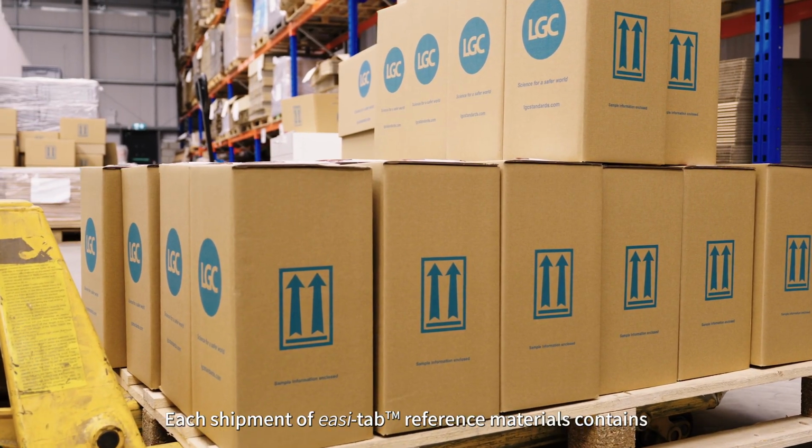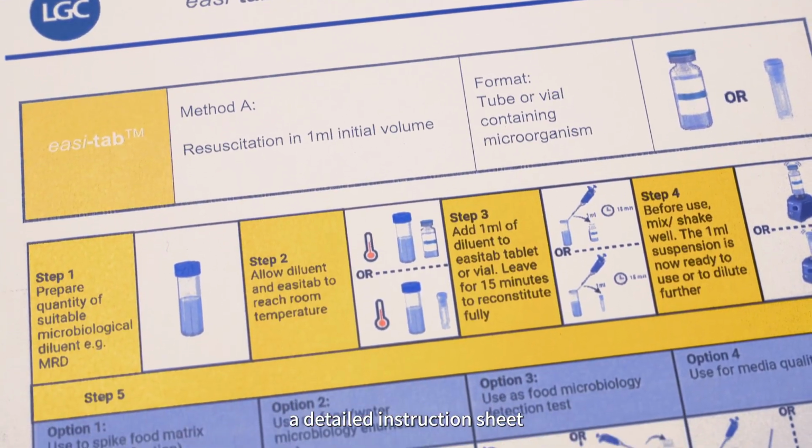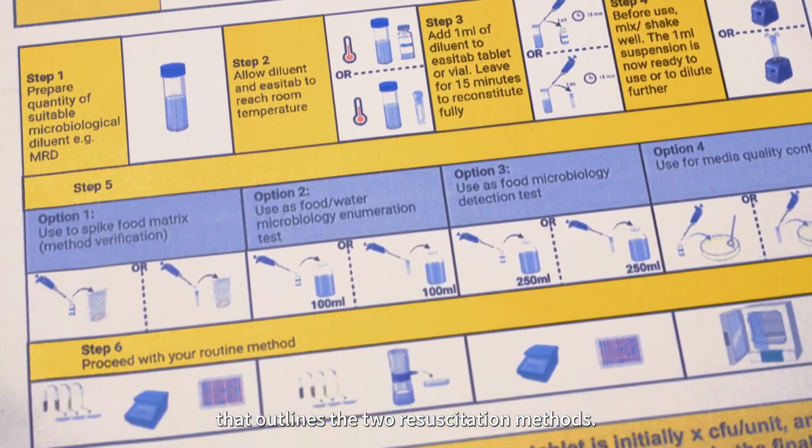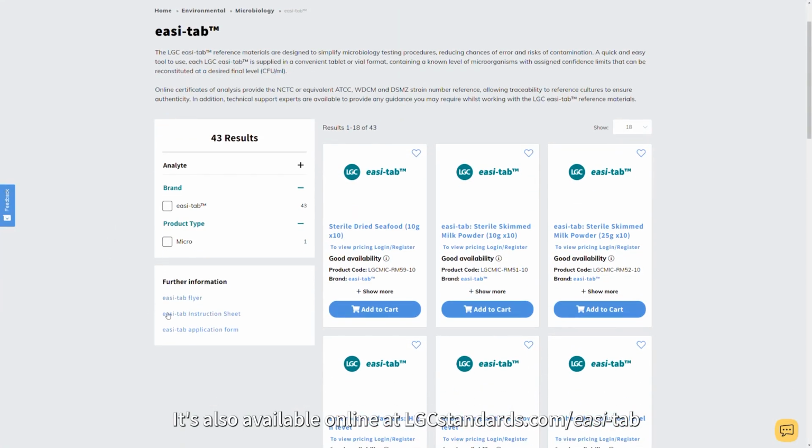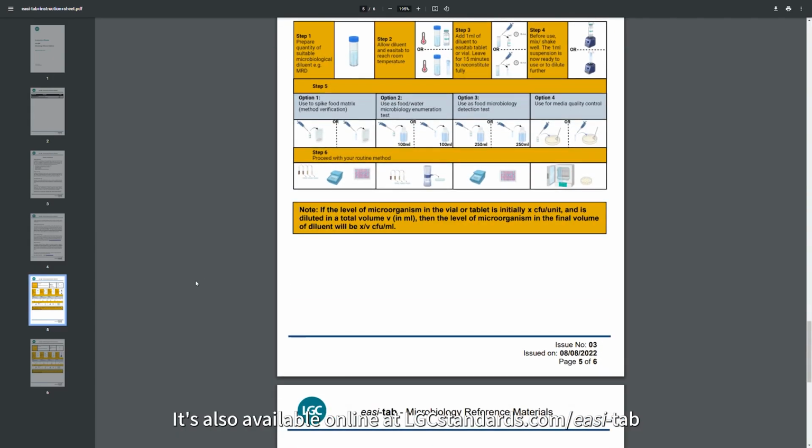Each shipment of easi-tab reference materials contains a detailed instruction sheet that outlines the 2 resuscitation methods. It's also available online at lgcstandards.com/easi-tab.